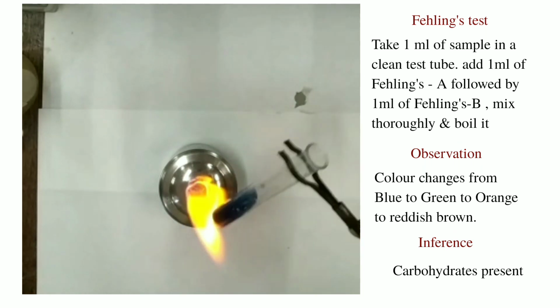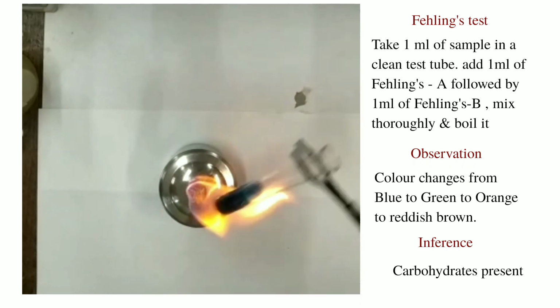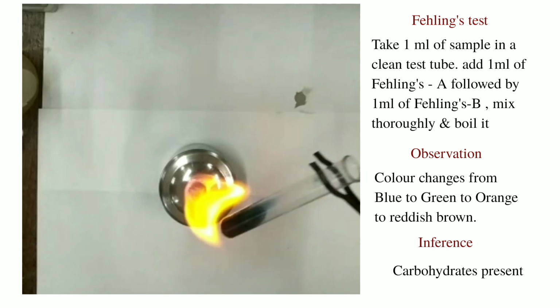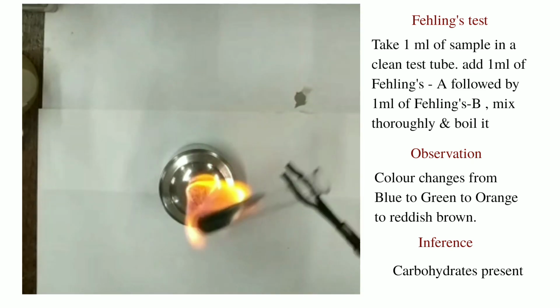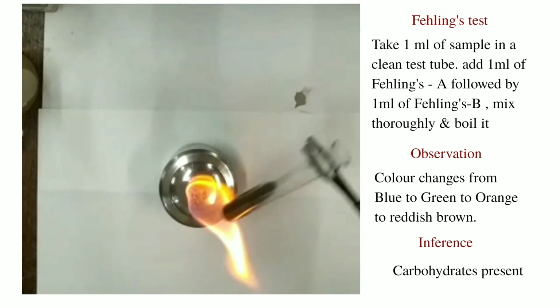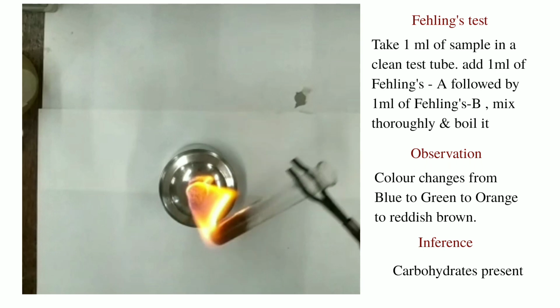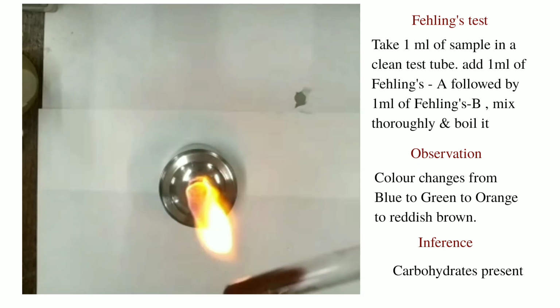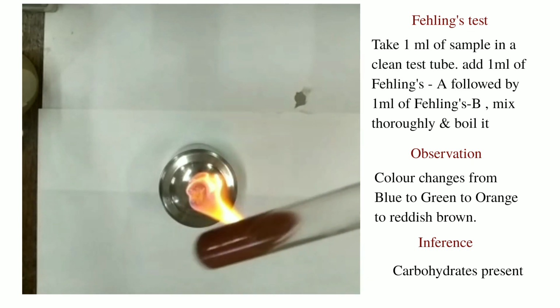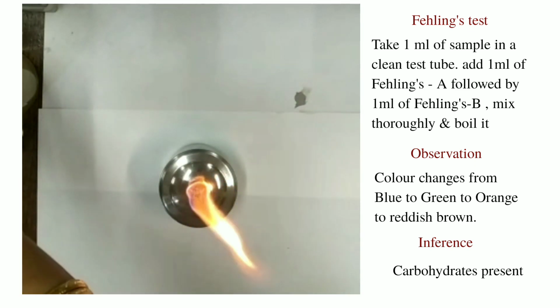As the solution boils, we can see the color change. It first changes into green, then to orange, and then gives a sort of reddish brown precipitate. So this indicates the presence of carbohydrates.